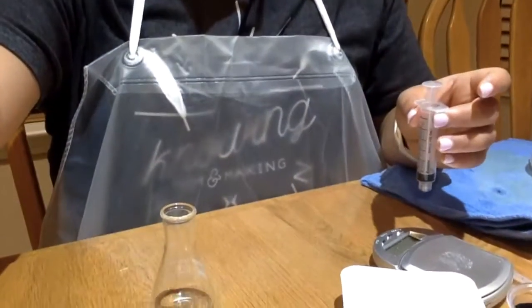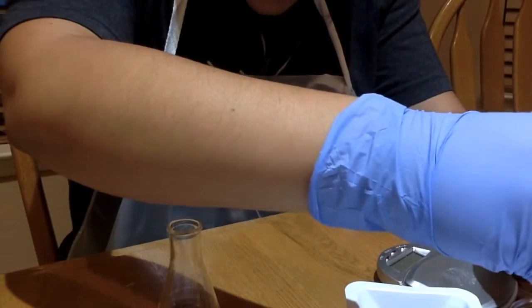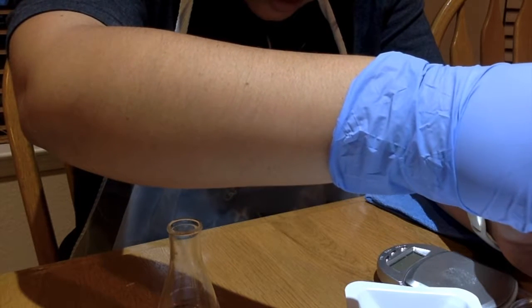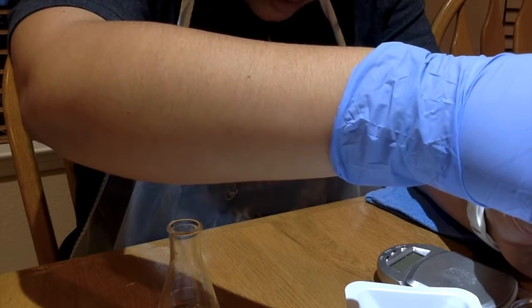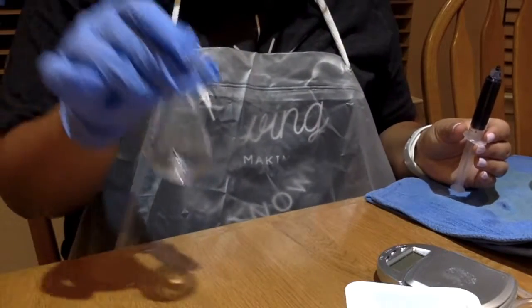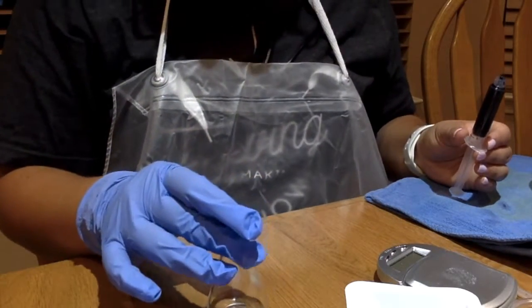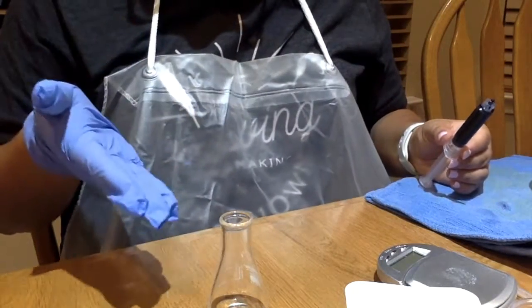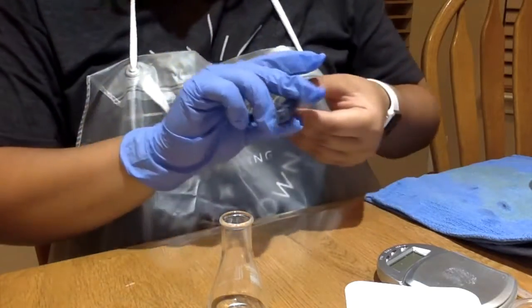So I'll be using the same method. I have my DCPIP in here, and I'm going to fill up my syringe right now to 5 milliliters, trying to not let any air in. Right there. Okay. And I've already put my unknown in here, and it said 2 milliliters. So I'm going to add in the drops and wait until there is a uniform color change.